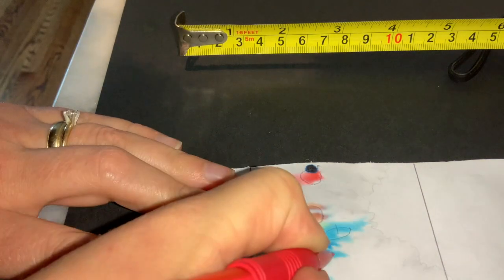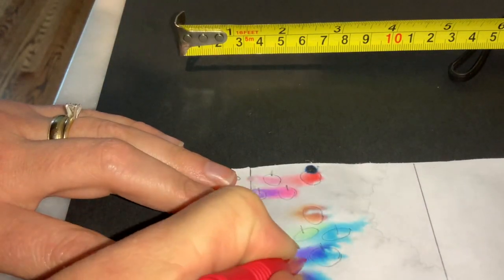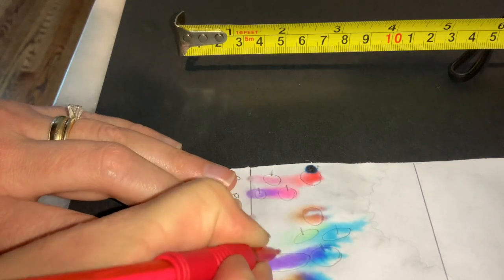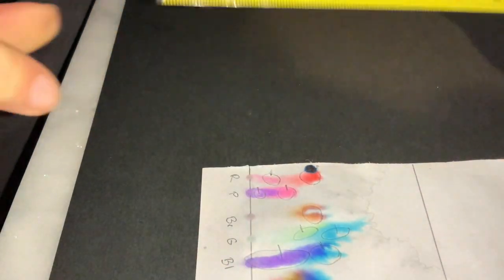Then my black, we have this color, and we've got this color. Sorry, my blue.